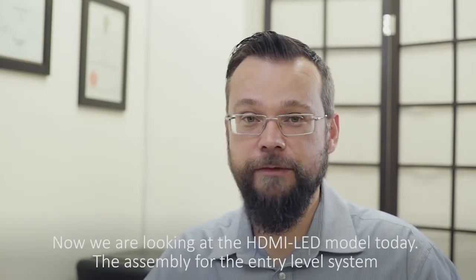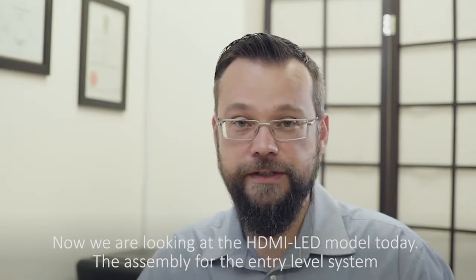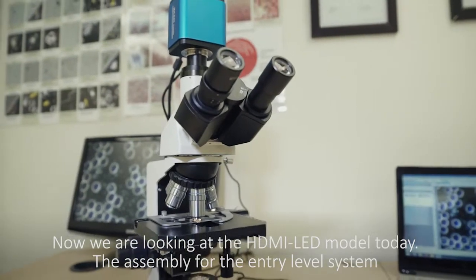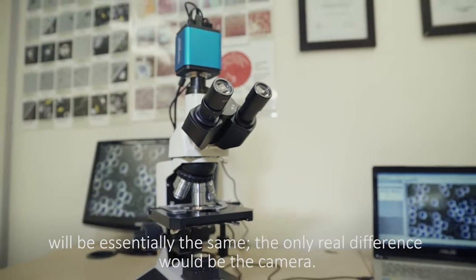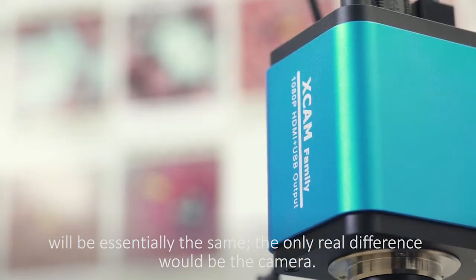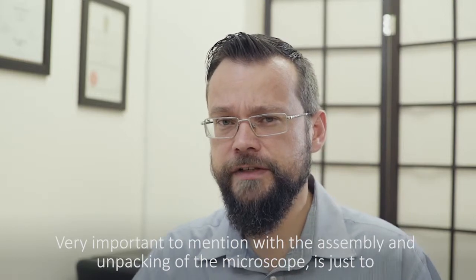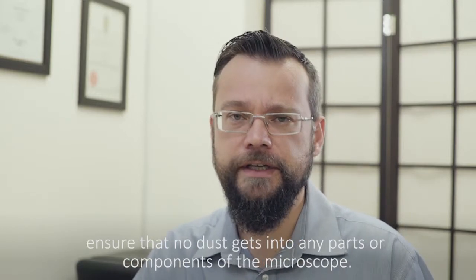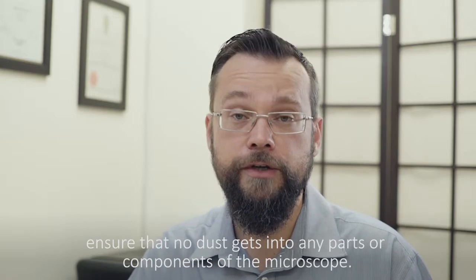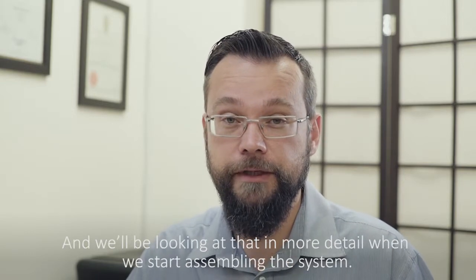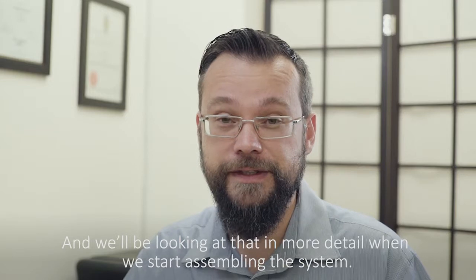We are looking at the HDMI LED model today. The assembly for the entry-level system will be essentially the same, the only real difference would be the camera. Very important to mention with the assembly and unpacking of the microscope is just to ensure that no dust gets into any parts or components of the microscope, and we will be looking at that in more detail when we start assembling the system.